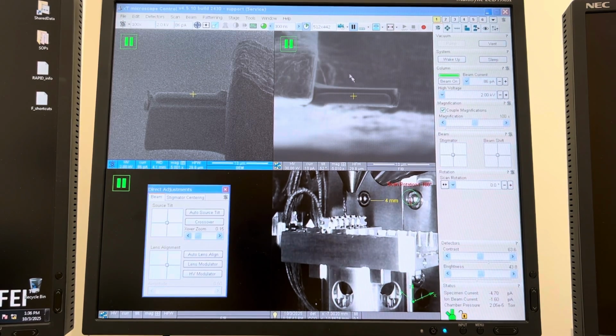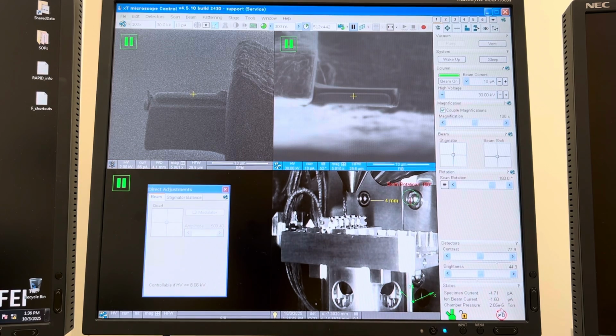And I didn't even notice this at first. I took this image at 10 picoamps and I was mortified. I'm like, that looks like crap, what's going on? And then I realized the vacuum's crap, okay? The vacuum's crap, this needs to get way better, and then you'll get a way better image. And of course, that's at 30 kilovolts, so it's only going to get worse when the voltage goes down, when you're doing your low kilovolt steps.